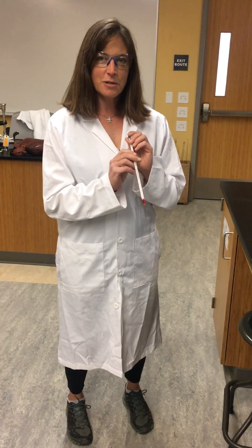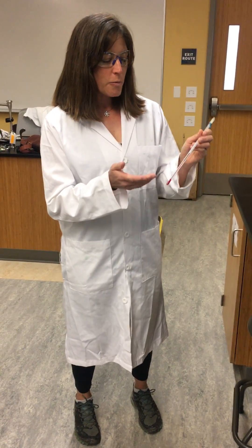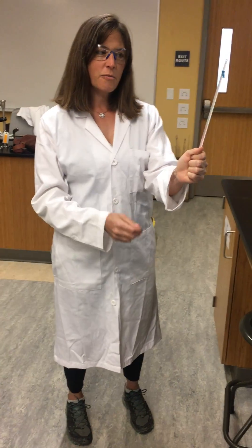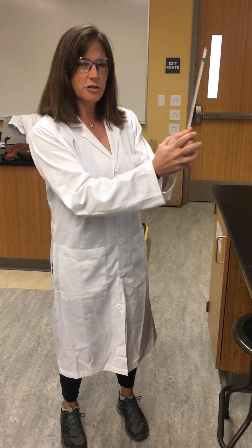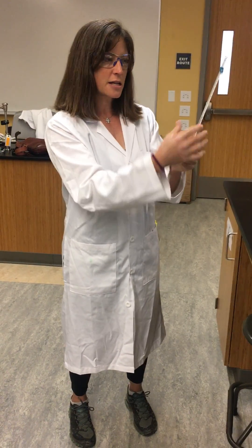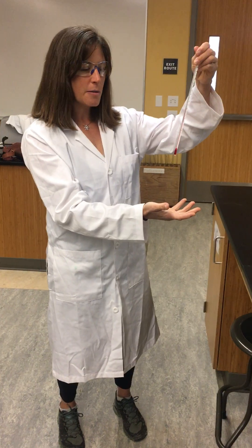When we're dealing with these thermometers, unlike medical thermometers, we do not need to shake these down. So when we want to measure the temperature of something, if we hold it like this, we're not measuring the temperature of the room — we're actually measuring the temperature of my hand. So we always want to make sure that our hand is away from the actual liquid inside of the thermometer.